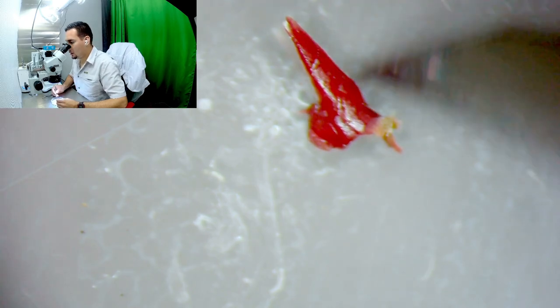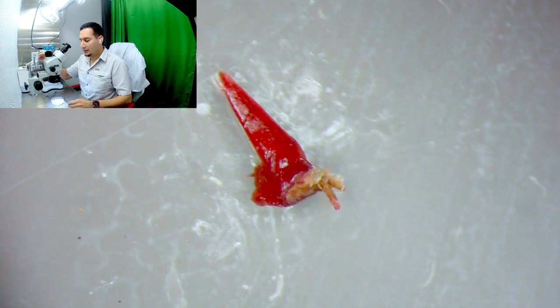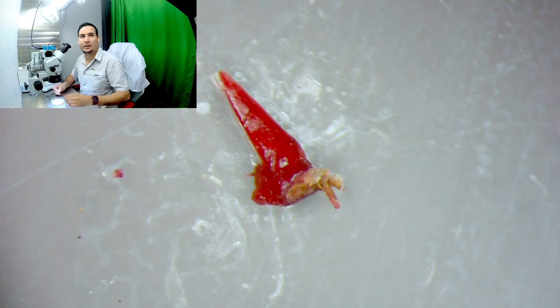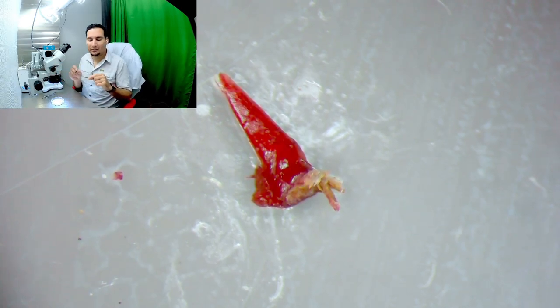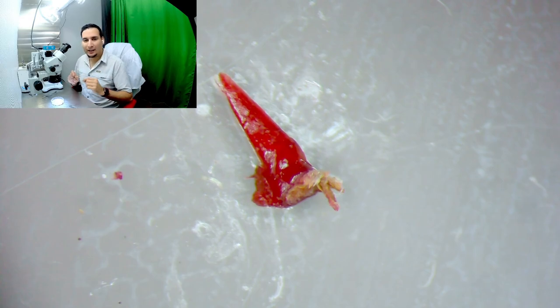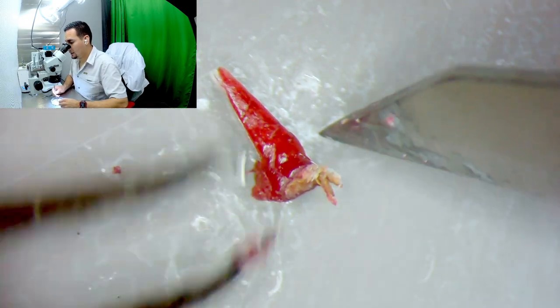I have to keep a constant look at the camera to make sure it's in focus. Something important in this work is that you have to keep doing very fine adjustments of your focus — both on the microscope and on the camera. As the explant gets smaller, it also gets out of focus, so you want to adjust to get the crispest image possible, which makes your work a lot easier.